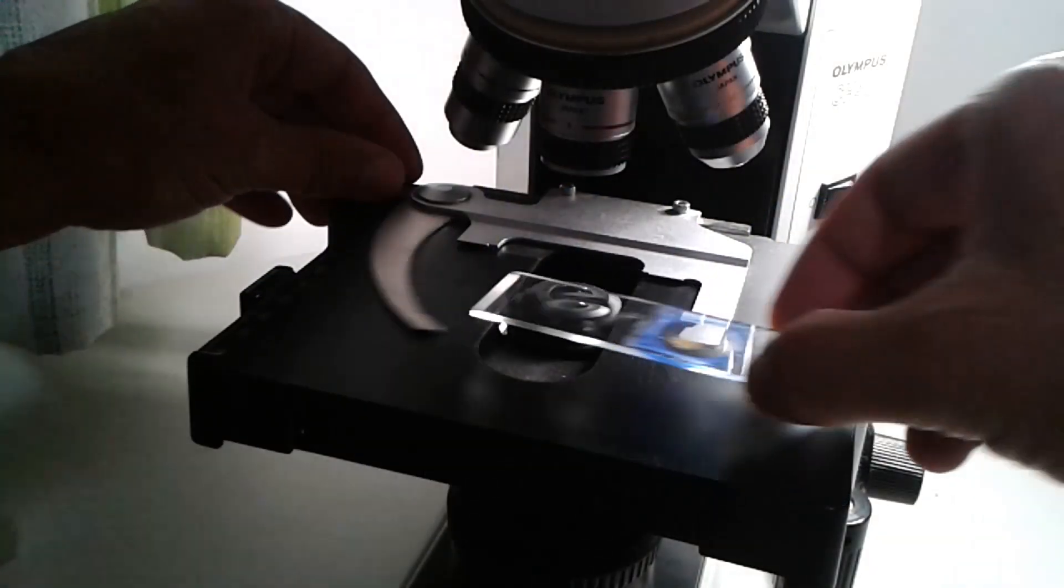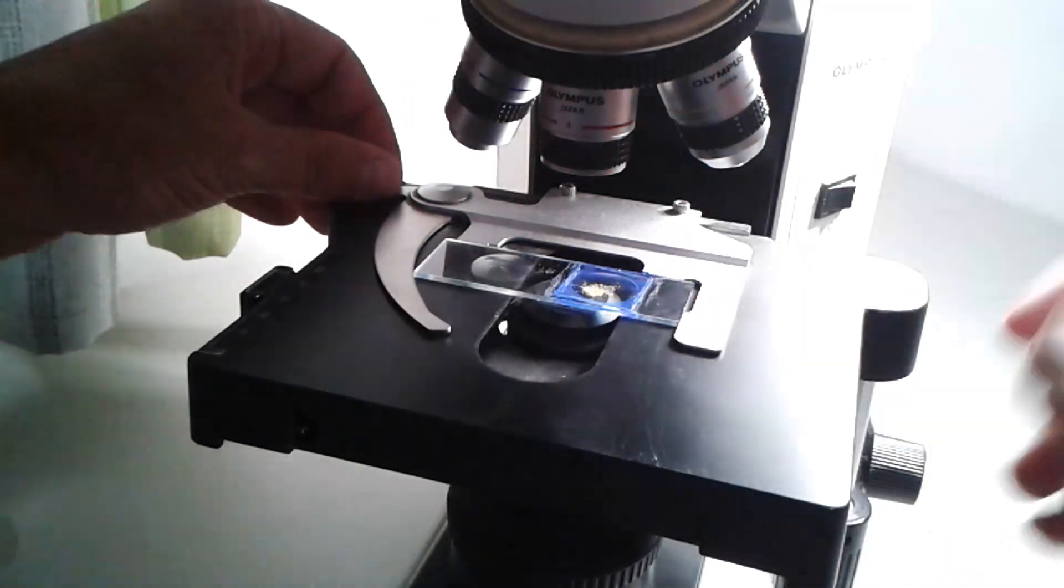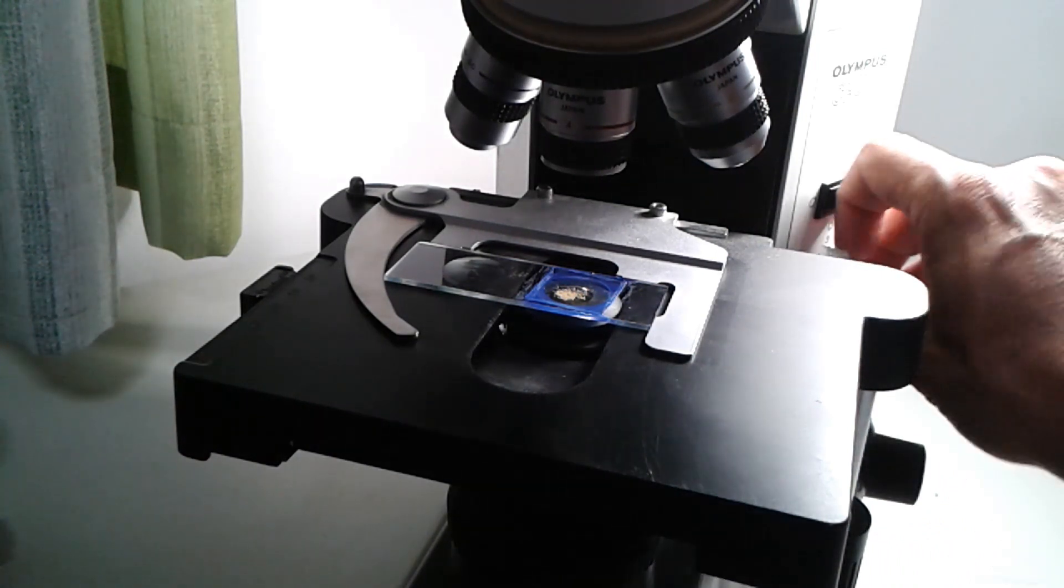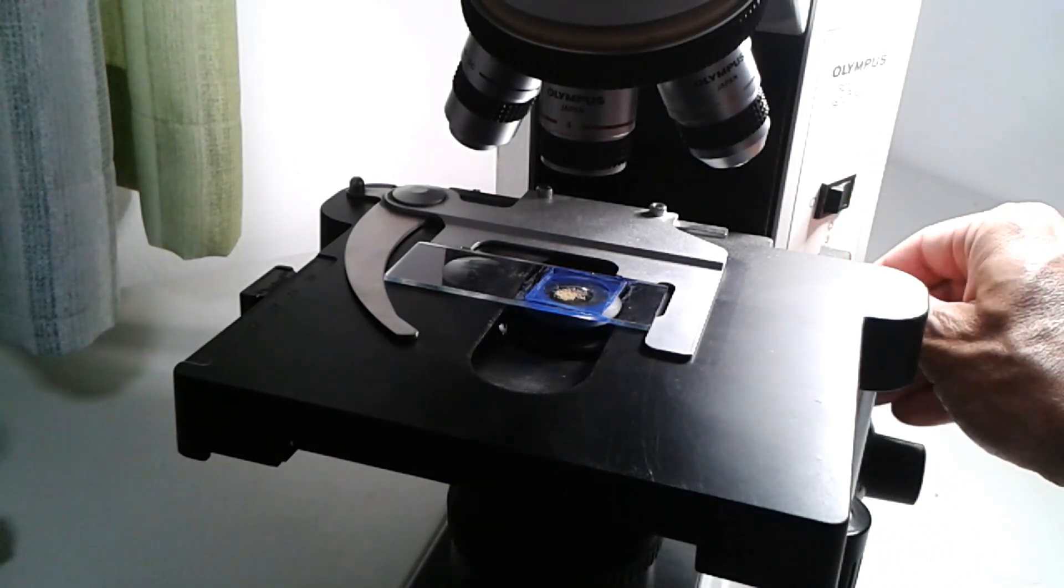Here are some examples of making spacer rings on regular slides - I'm going to do a separate video on this as well. Then I put everything under the microscope, switched on the light, and let's get started with pollen microscopy.